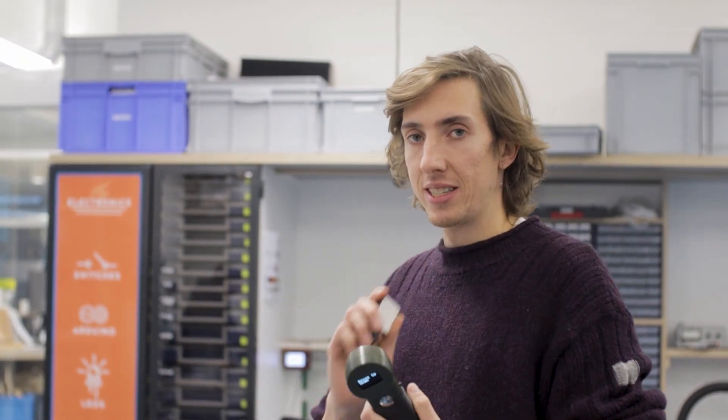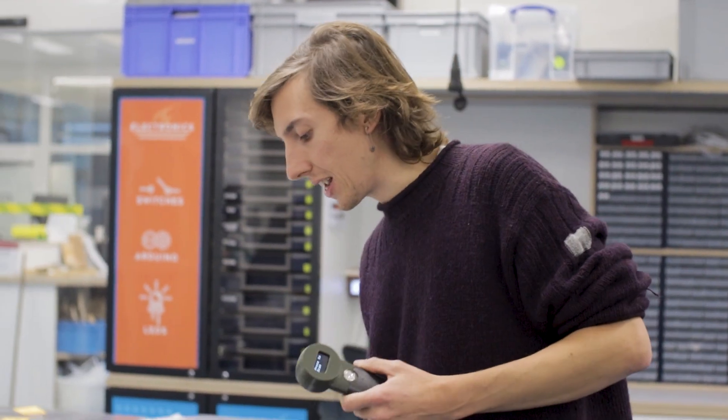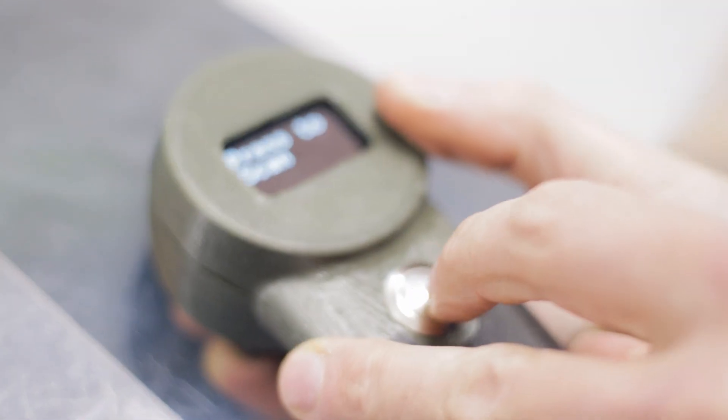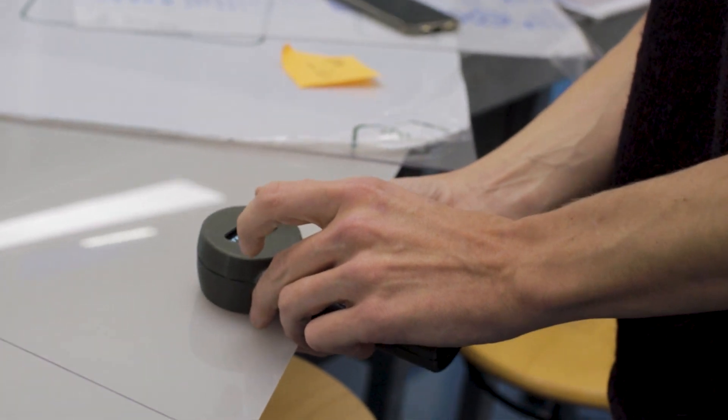Here I have the plastic scanner. I already did a little calibration step, and basically now, because they are transparent sheets, we put a little bit of reference material on the back, then put the plastic scanner on there, press scan, and it says this is most likely a PET sheet, which we also believe due to the characteristics of the sheet.